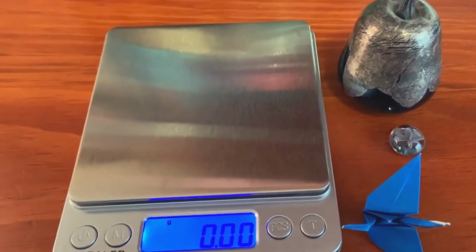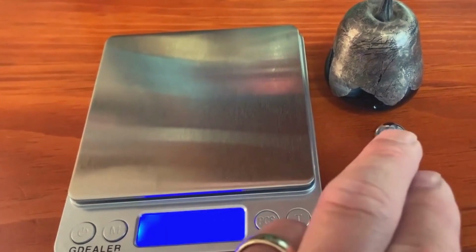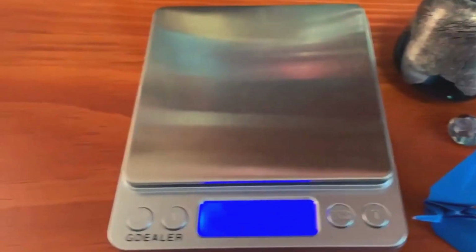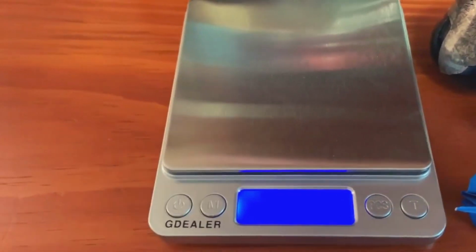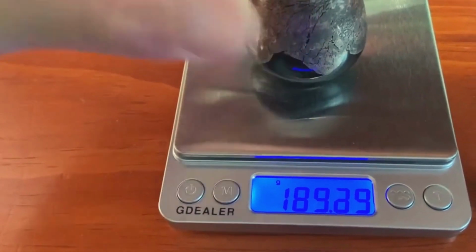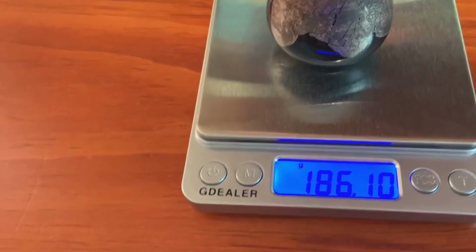So you need to get three objects, sort of a light, small object, a medium-sized object, and then sort of a heavier object. Now, the limit of this balance, I believe, is 250 grams. So if you find an object that's heavy, like this one, you place it on there, as long as it can read the balance, you're good.